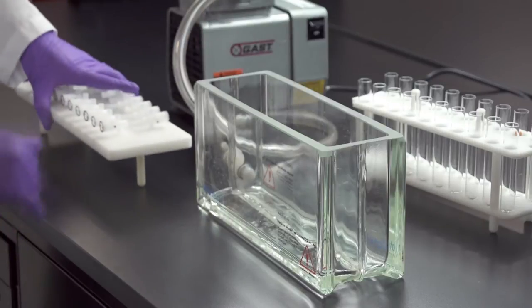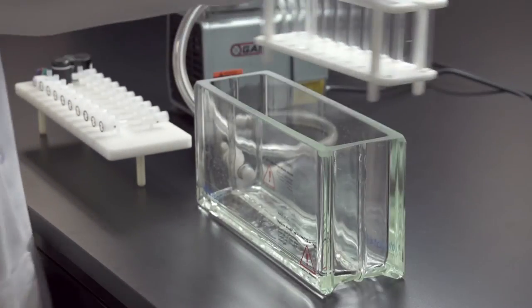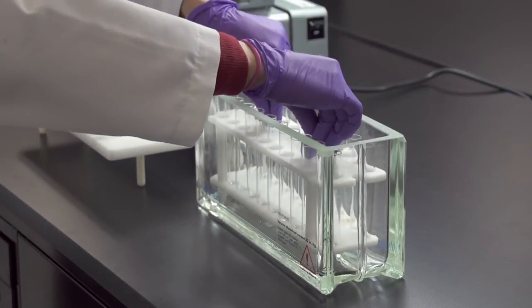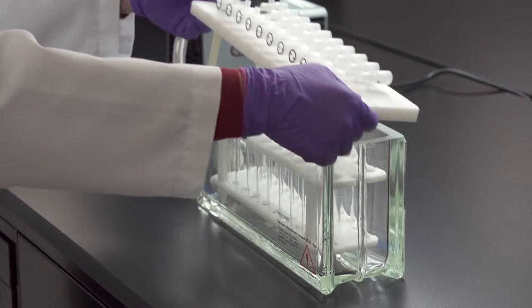Remove the manifold cover and place an appropriate rack with collection tubes or vials inside the manifold and replace the cover.